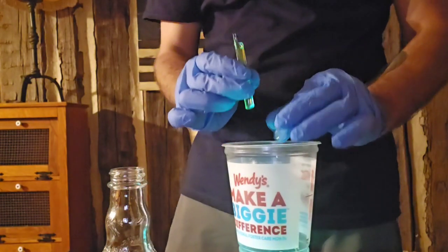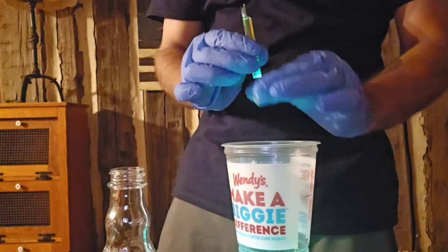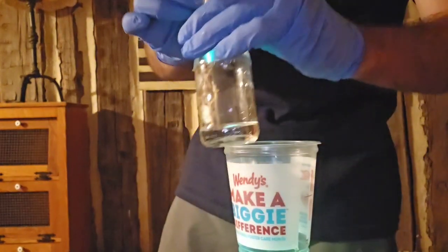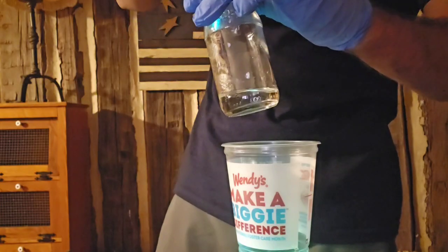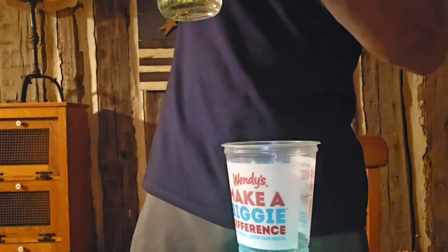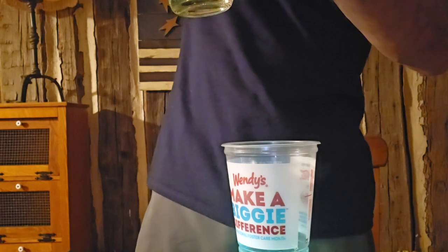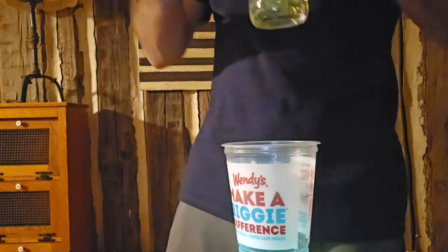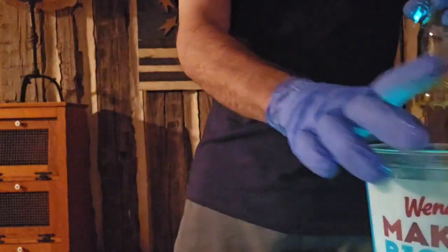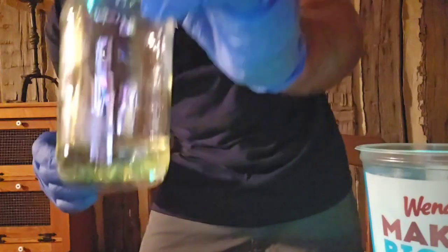All right. Now, let's go ahead and try to get this in here. Pour all that in there. Okay, all that we can get in there. All right. Throw that broken glass. See what happened in the bottom of it? It's brighter than it could be. Look at that, huh? But this isn't glowing yet, right?